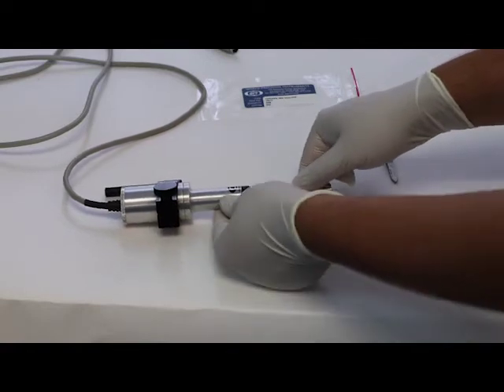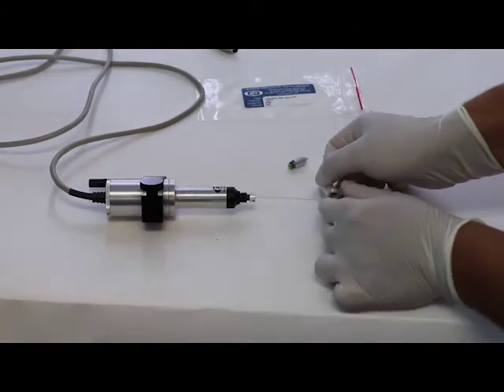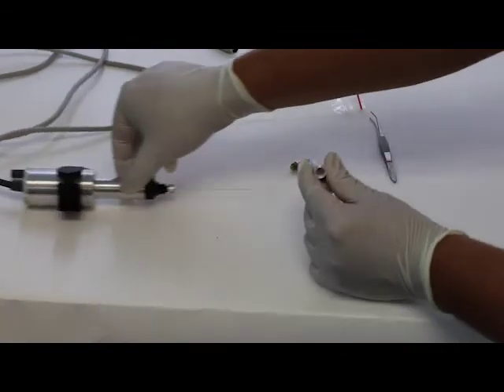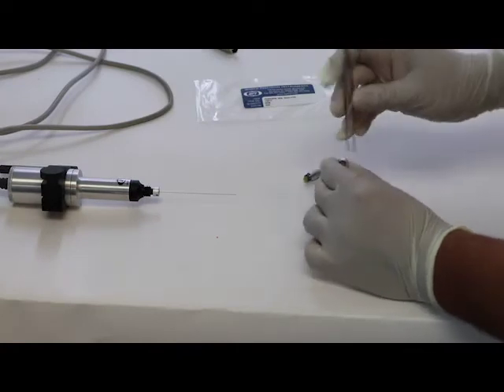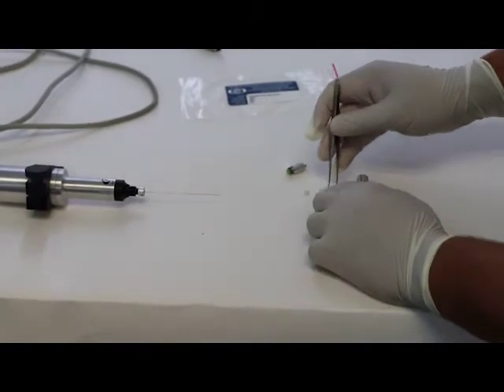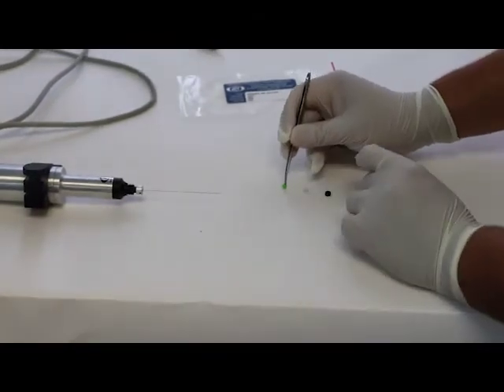Second thing we're going to remove is the body of the injector. And with the tweezers that are included in the package, you get to remove the sealing and the spacer gasket that's inside. And now we have removed all three gaskets and we'll be ready to replace them.